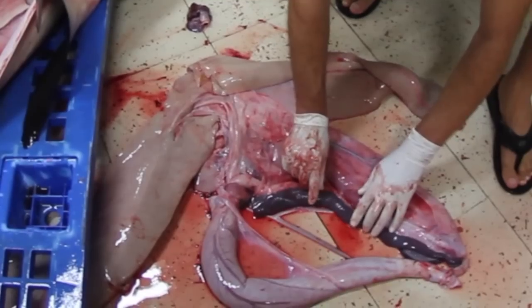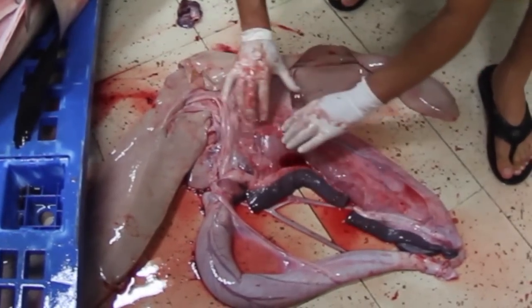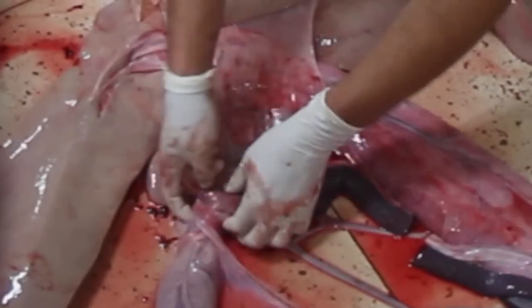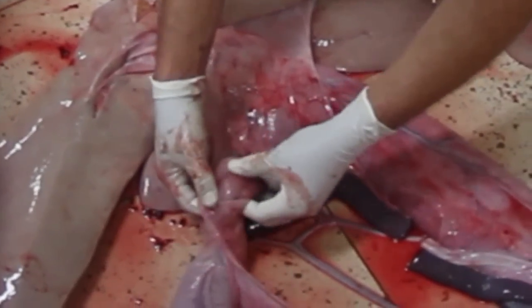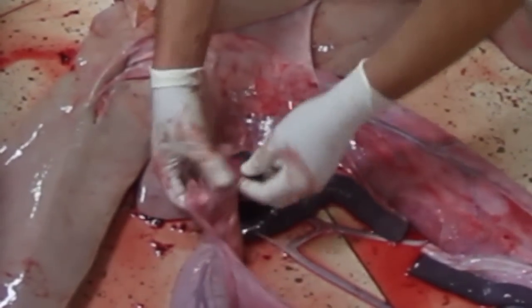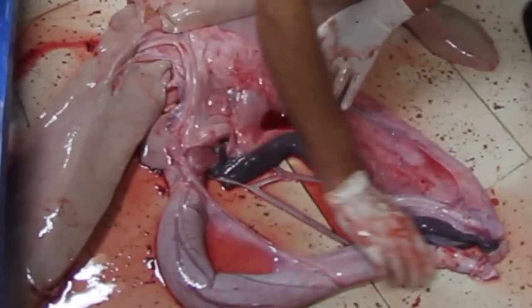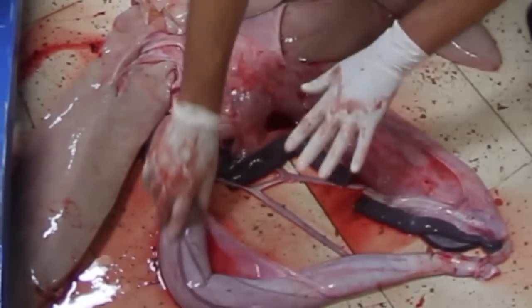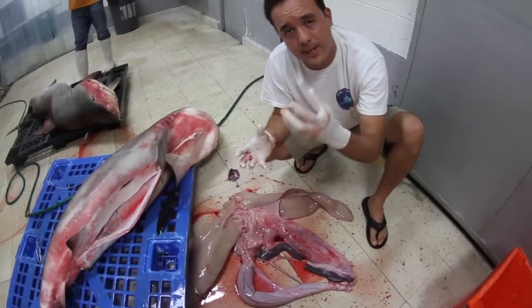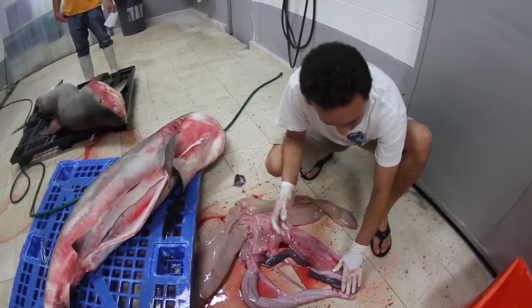Here we produce all the blood cells — this is what we see here. And this is the pancreas, producing all the enzymes for digestion. Then the stomach is connected with the intestine, which is the organ where they absorb all the nutrients.